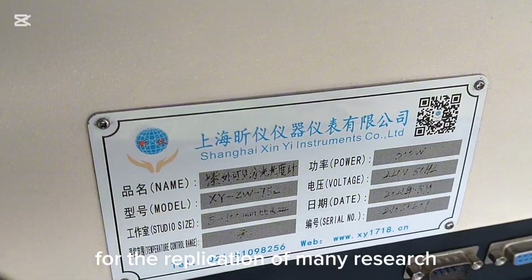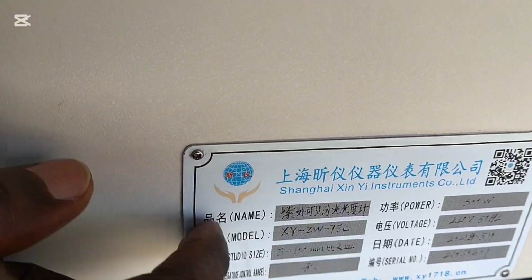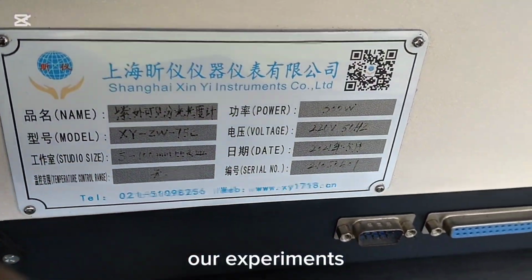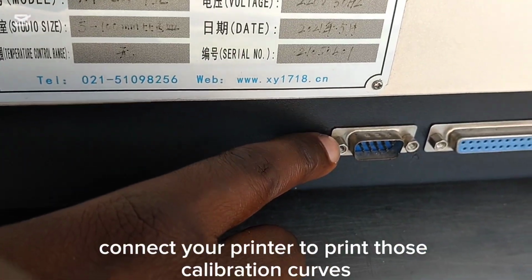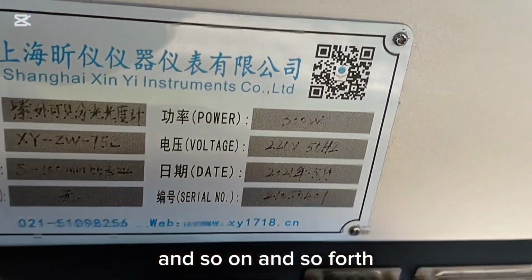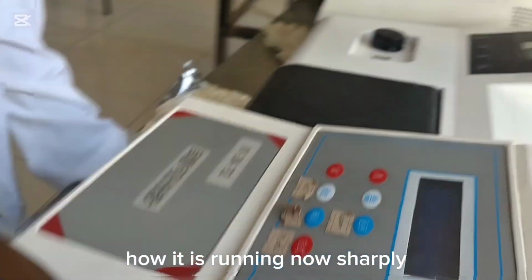For the replication of much research, we have to use the model number or the model code if anyone wants to replicate our experiments. Of course, we have where to connect the projector or to print. This is where you can connect your printer to print those calibration curves and so on. Then this one is probably for the projector to see the image, how it is running.